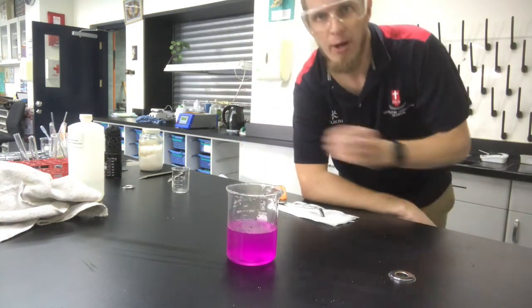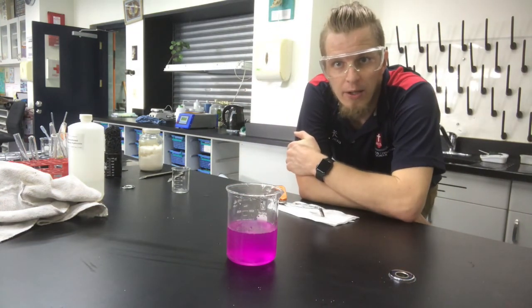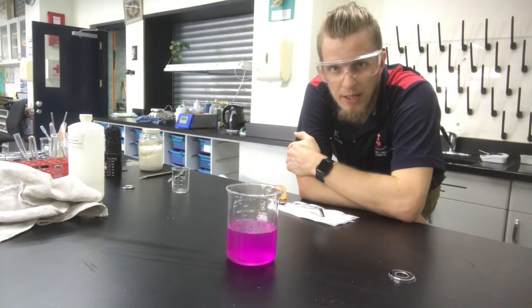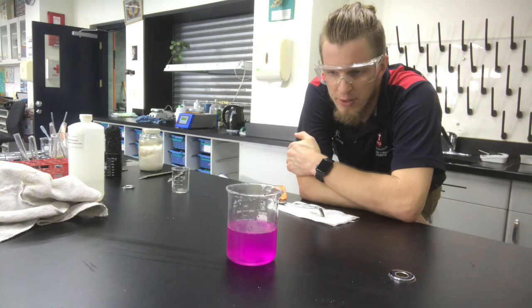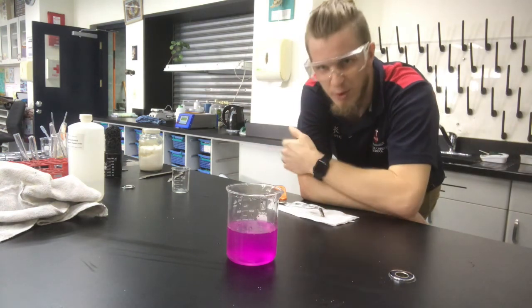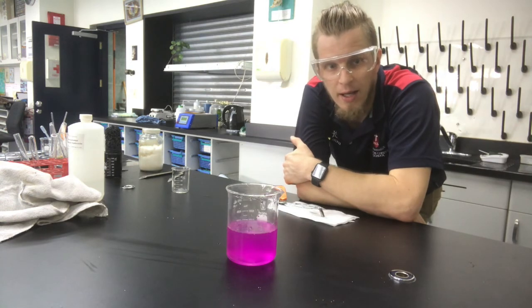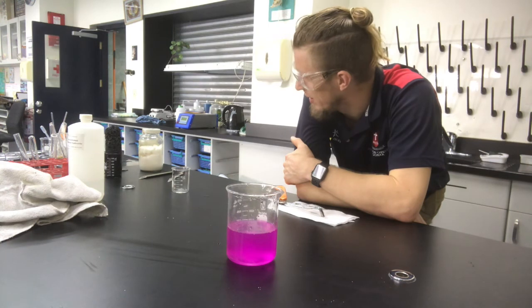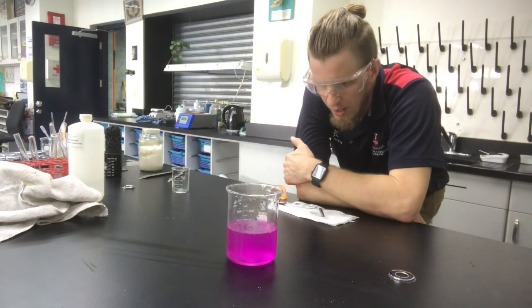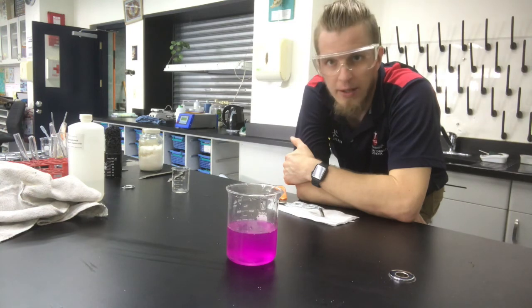Okay, but hopefully you guys saw how we got different color changes, we got heat produced, okay. A couple of times we got sparks, we didn't quite get the light that I was hoping for, but you kind of get an idea of all those different observations around chemical reactions.